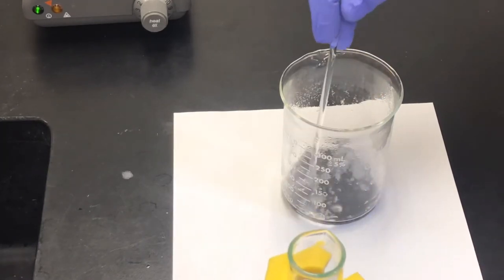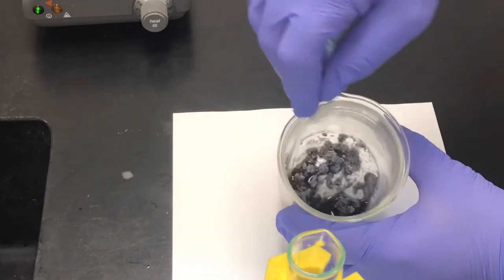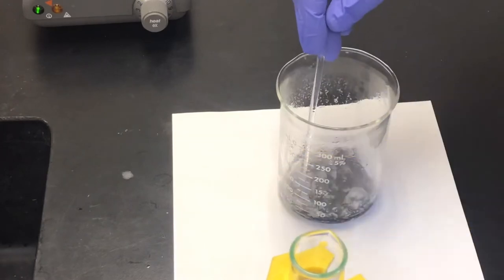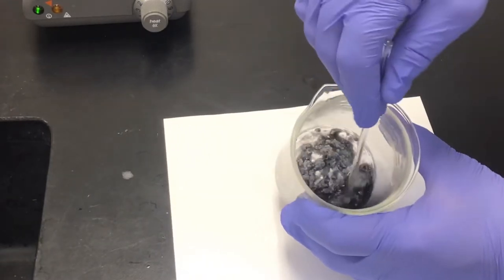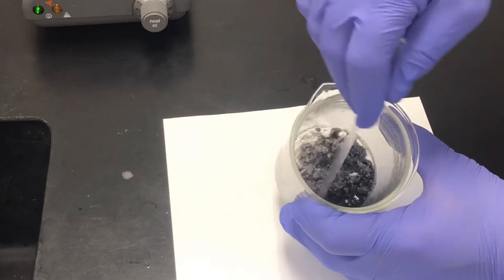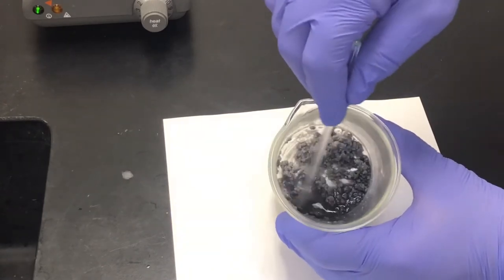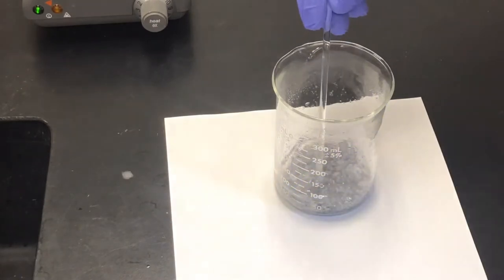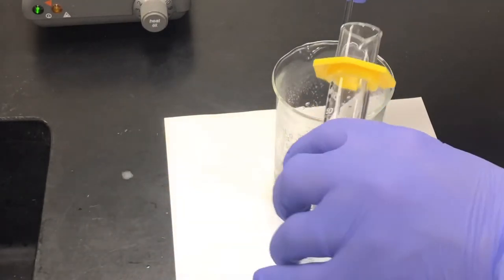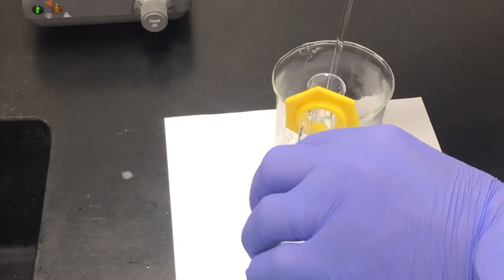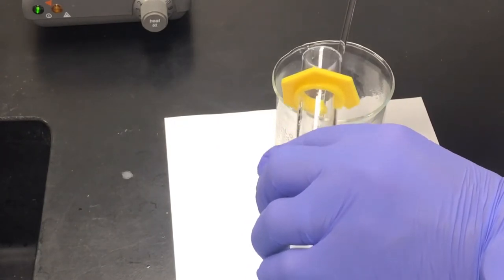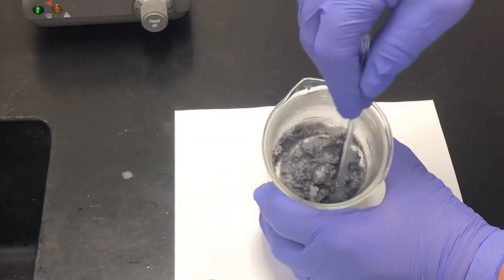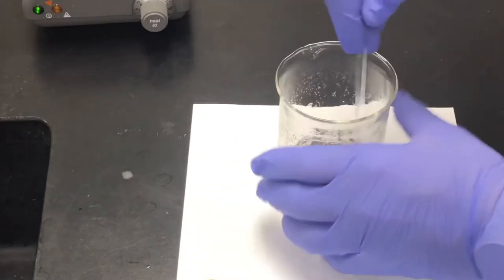So all of the black coloring is going away. It's almost a paste. It is warm to the touch.